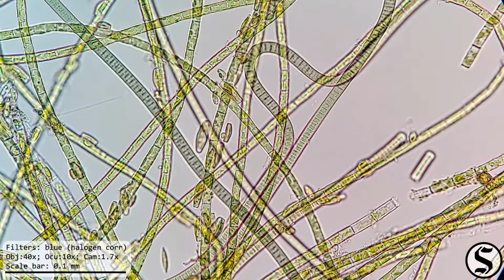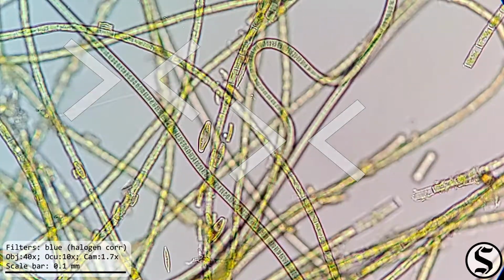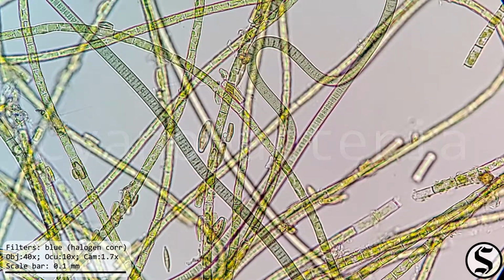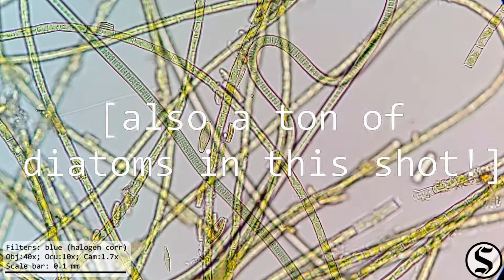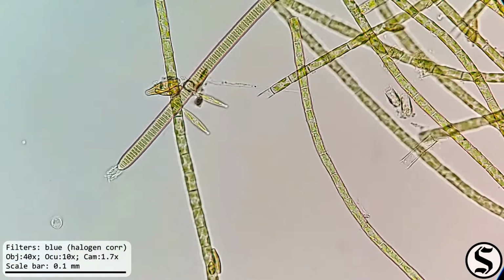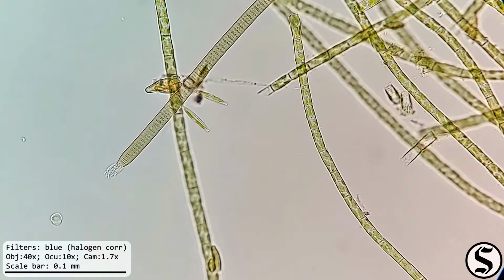Now these moving filaments are of the phylum Cyanobacteria, which are the blue-green algae, and their name comes from the Greek kyanos for dark blue, same root as cyan, and bacteria, meaning rod. Look at that thing move.